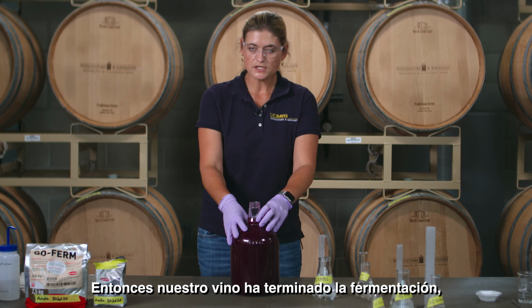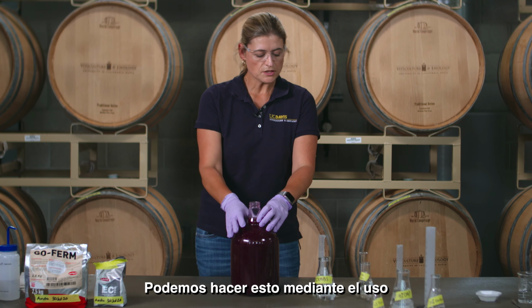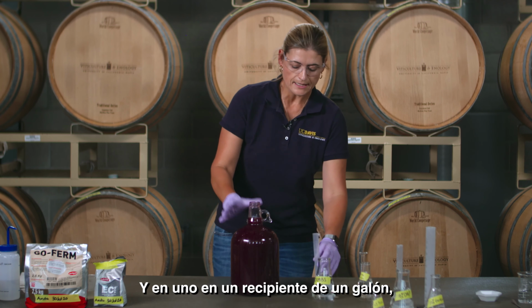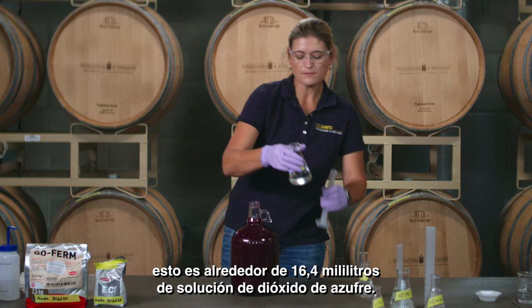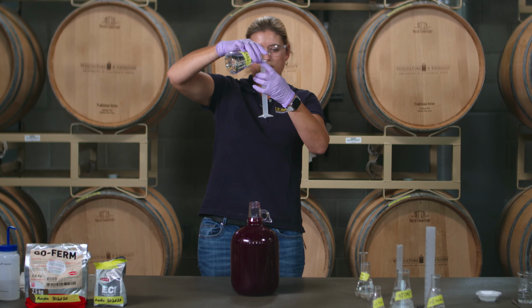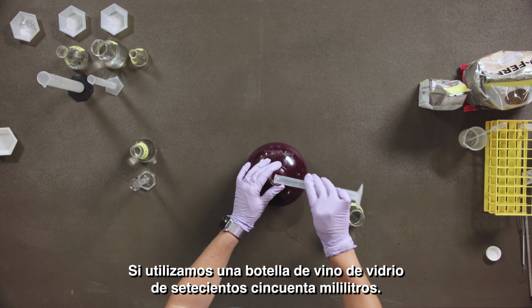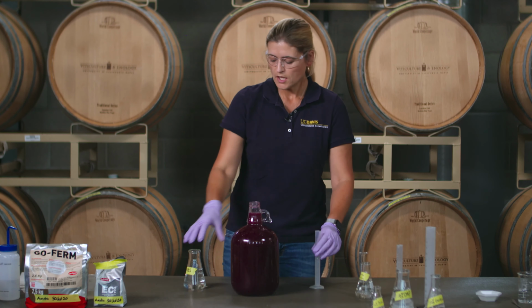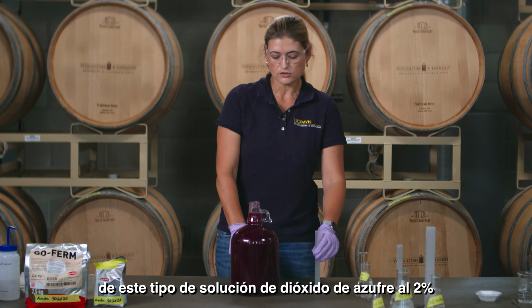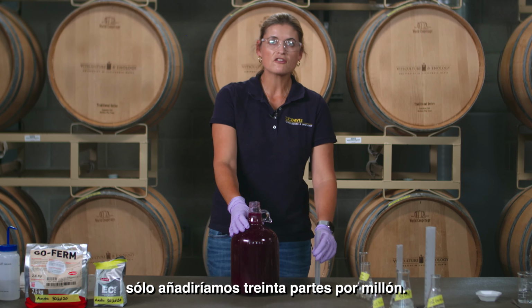So our wine has finished fermentation, and we're going to make a 50 parts per million sulfur dioxide addition. We're going to do this by using our 2% potassium metabisulfite solution that we've made up before. And in a 1 gallon container, this is about 16.4 milliliters of sulfur dioxide solution. If you used a 750 milliliter glass wine bottle, you need to add about 3.3 milliliters of this 2% sulfur dioxide solution to get 50 parts per million. If you were making a white wine, you will only be adding 30 parts per million.